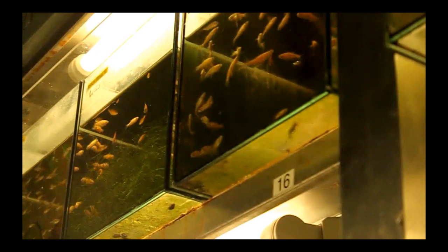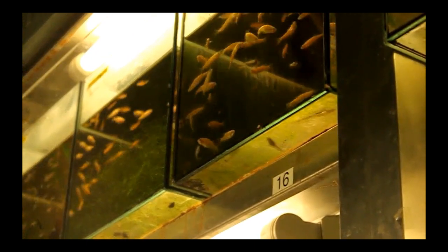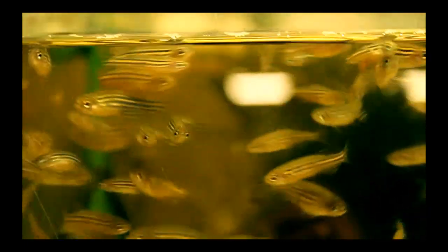Although ENU screenings in zebrafish require less resources and staff compared to screens in mice, breeding several generations is elaborate and time-consuming.